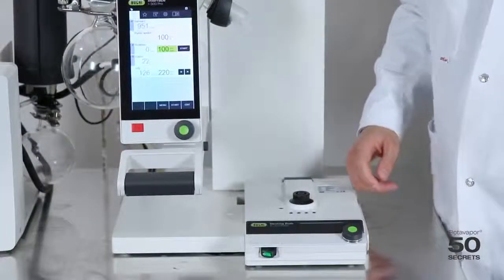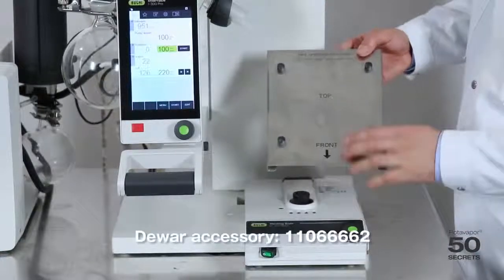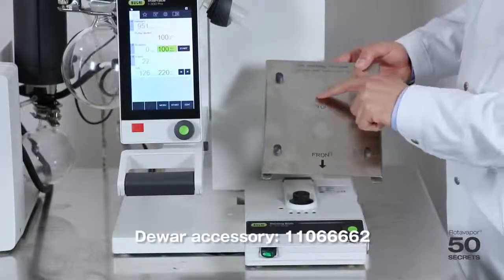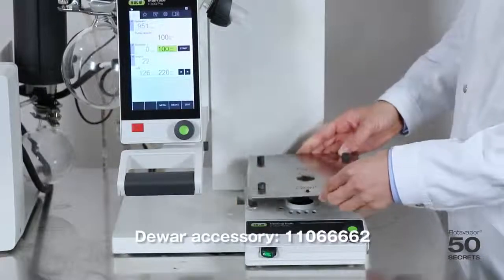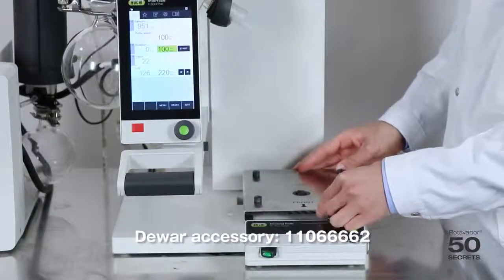Second, we use the adapter, which looks like this. It has a clear front marking and a top marking. We just place it onto the B300 base, just like this.